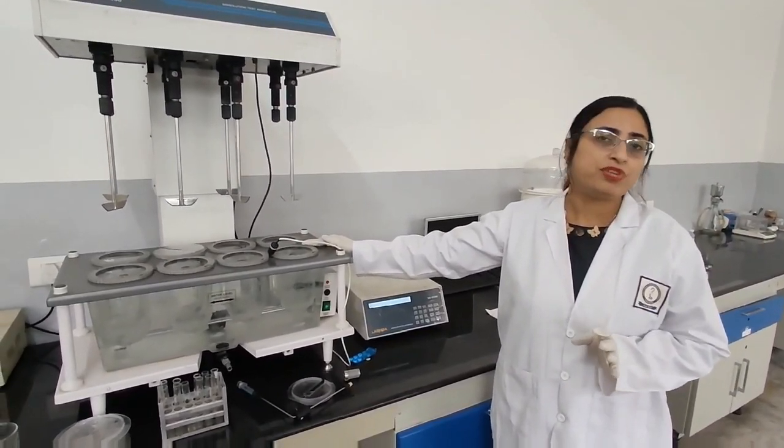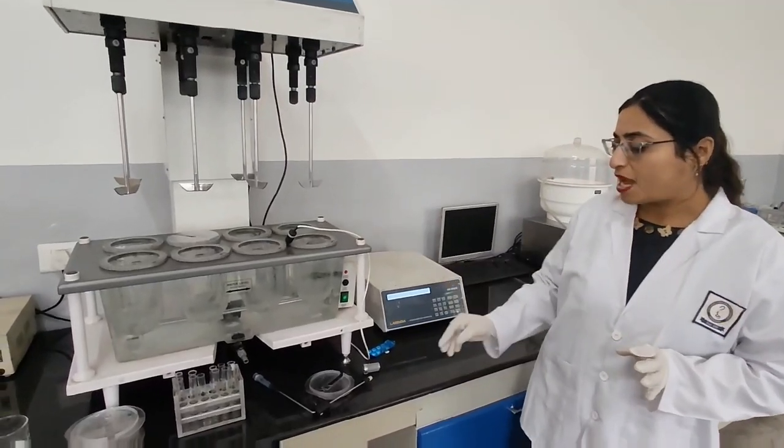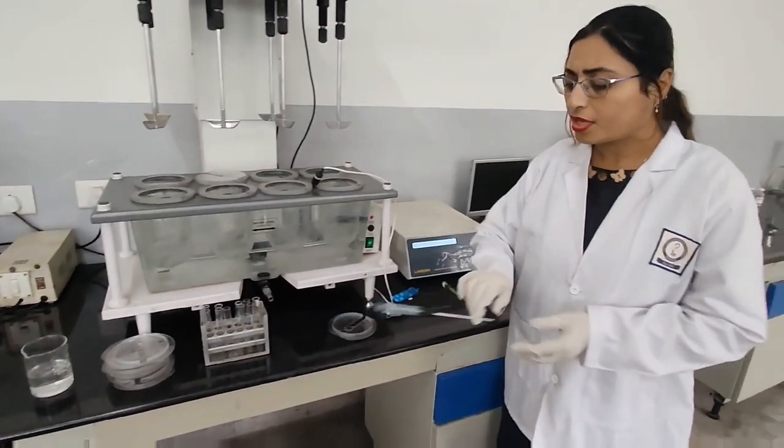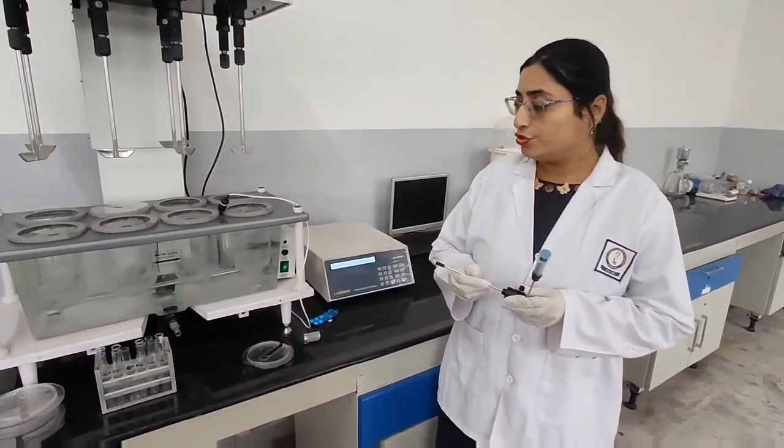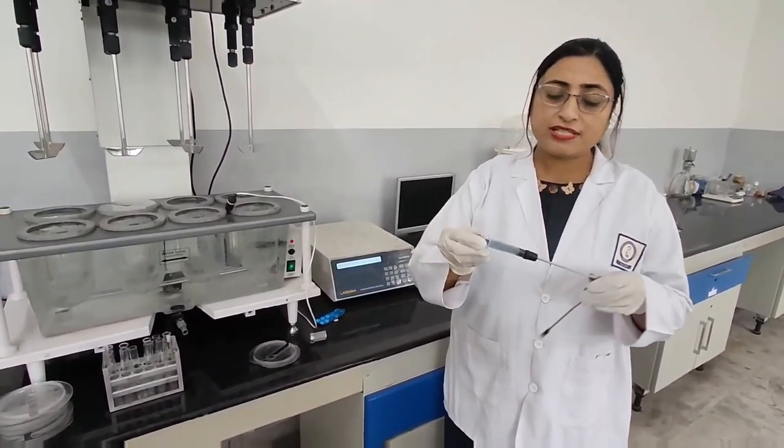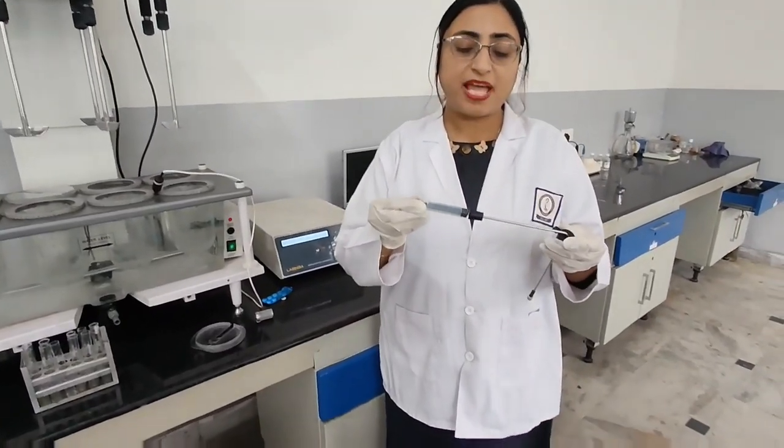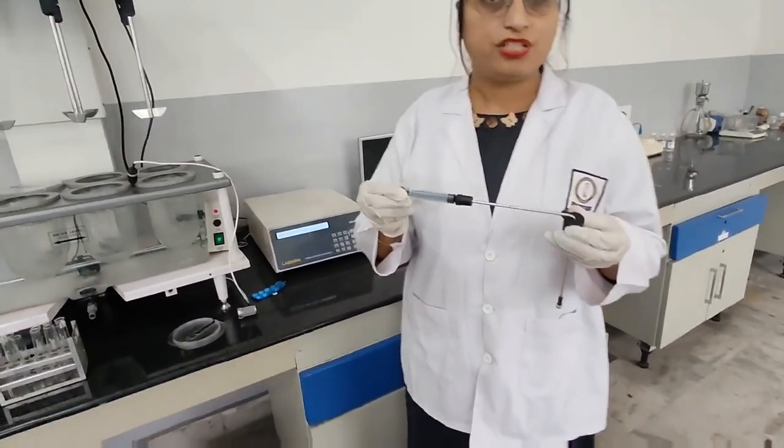Next part is this cannula. This is used to withdraw the sample from the dissolution jar. And syringe, you can see this syringe is attached at the back to suck the sample from the dissolution jar.